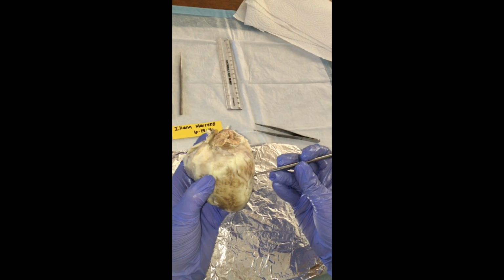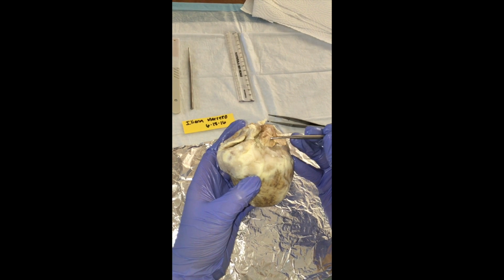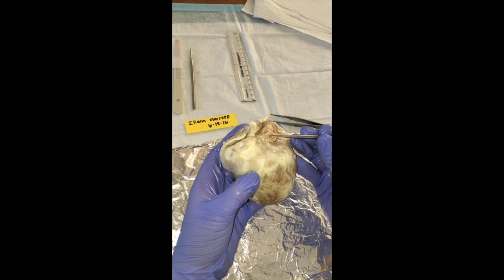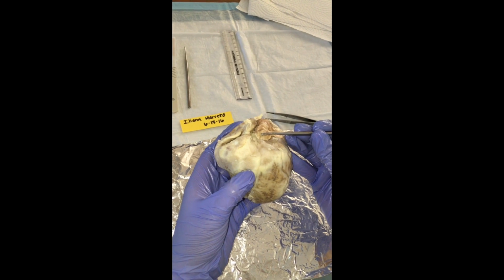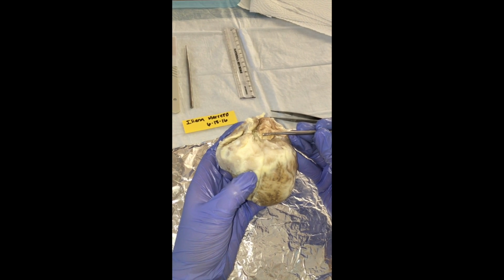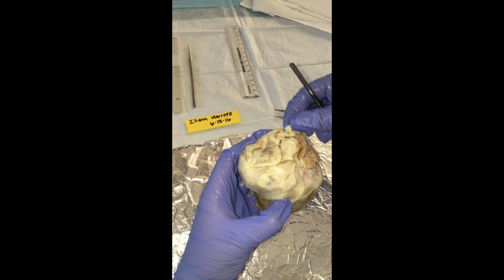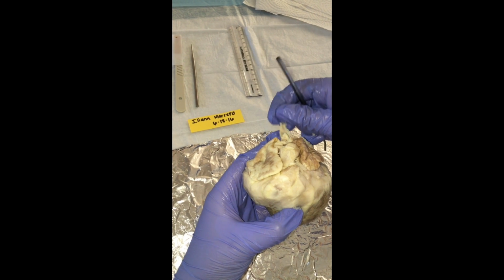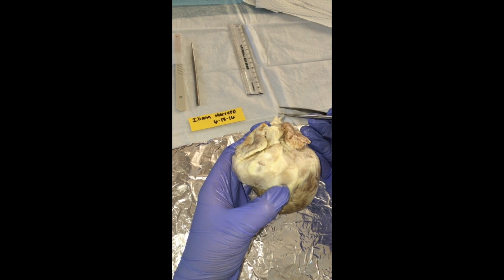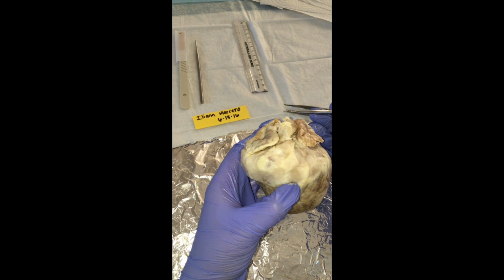Next we have the pulmonary trunk, which is this large area here, middle tube. And the blood in this vessel goes to the lungs where the gas exchange occurs, and it's oxygenated. Then we have the aorta, which is found back here. This vessel pumps blood from the heart to all parts of the body, and it's also oxygenated.